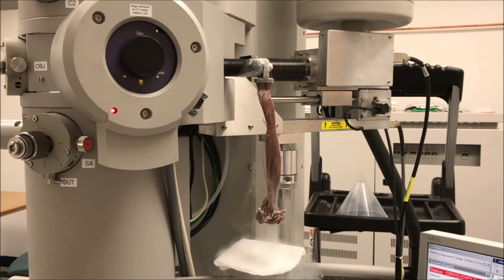The microscope is unusable while the cryocycle is running. Generally, the cryocycle runs six to eight hours, or if you do it at the end of the day, overnight. When you come back in the morning ready to use the microscope again, you have to refill the cold trap. This concludes the video about the cold trap and cryocycle. If you have any questions, comments, or suggested topics for future videos, please let me know. Thank you.